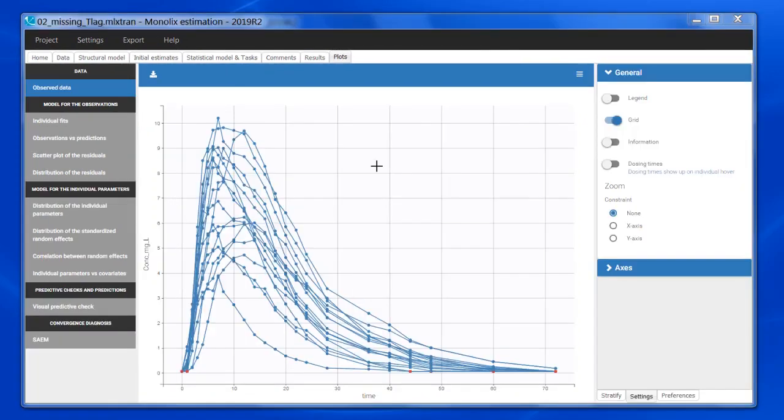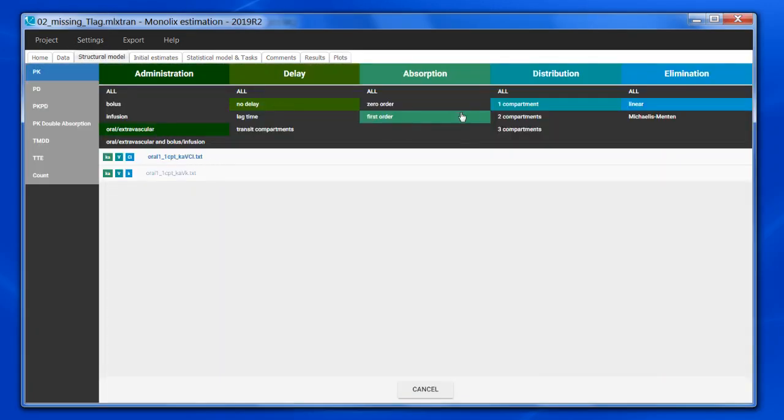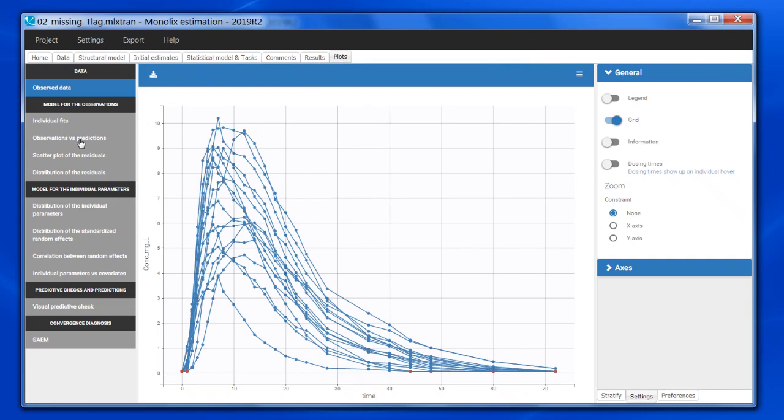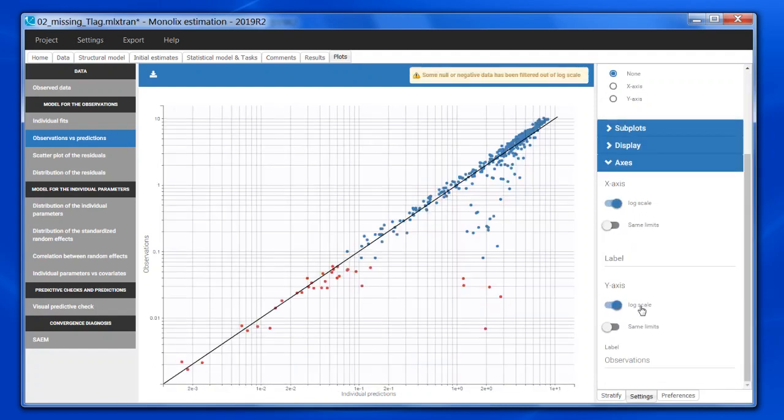In the second example, the data is for theophylline after an oral dose. The data looks like this, and I have fitted a one compartment model with first-order absorption and linear elimination. If I go to the Obs vs. Pred plot, I already see a trend in linear-linear scale. And if I change to log-log scale, I can see this smear of values in the lower part of the plot. If I check the times, it always corresponds to small times around 1. This pattern is typical of a missing T-lag.